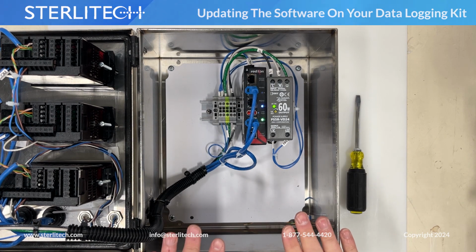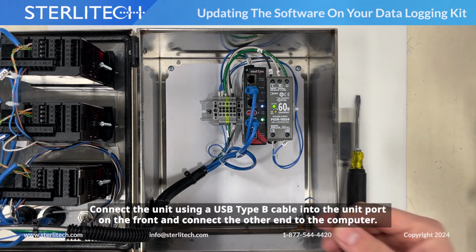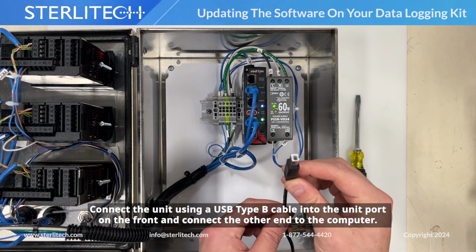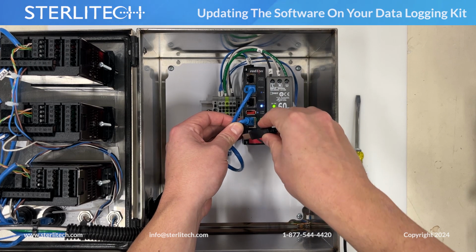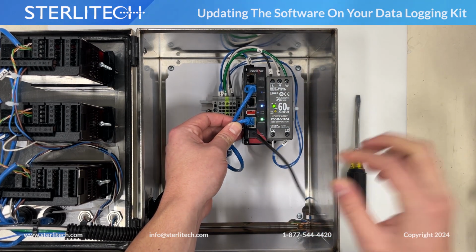It will look like this on the inside. We'll need to use a USB to a USB Type B cord. Plug the USB end into your computer and the USB Type B end into the very bottom port of our DA30 device here. Just like that. And then we'll move on to our computer.